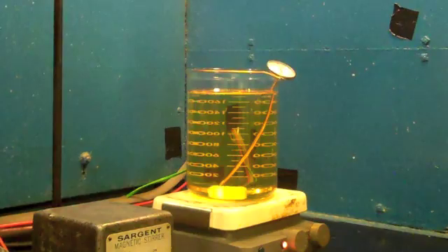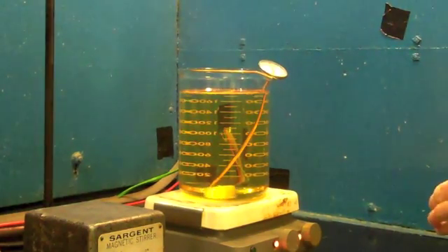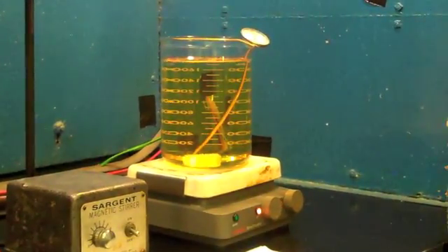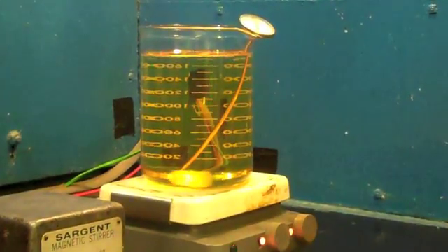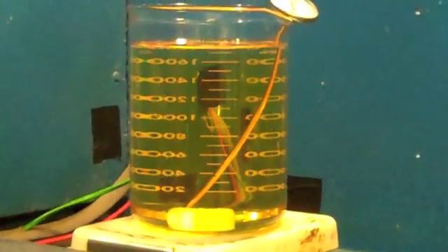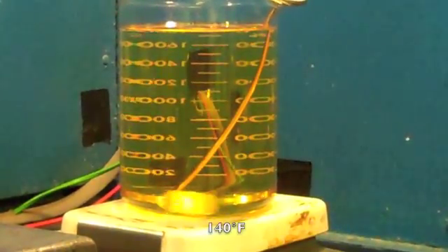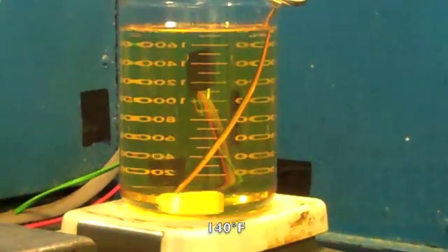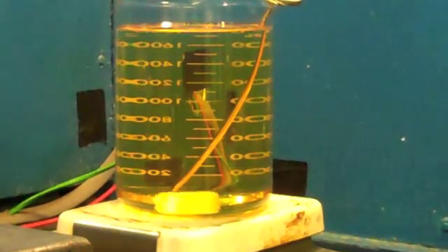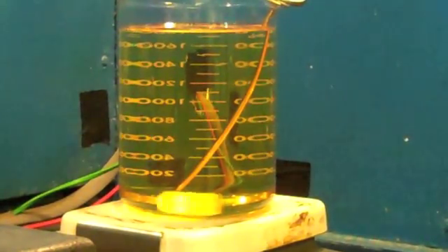The equipment we use for this test includes a hot plate with magnetic stirring capability. The sample we are currently heating up is AAA quench oil, and the temperature that we normally test this at is 140 degrees Fahrenheit. We heat it uniformly with agitation until we reach 140.